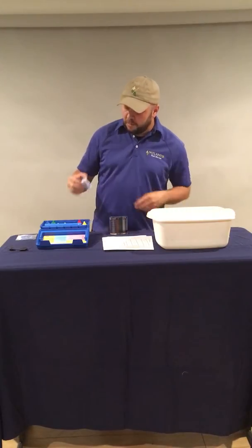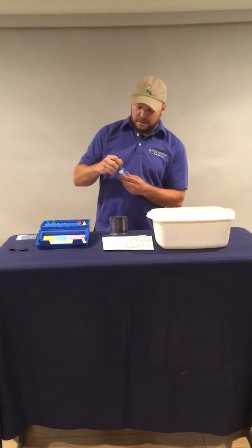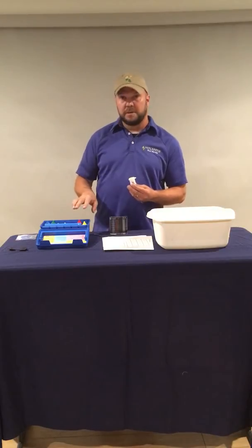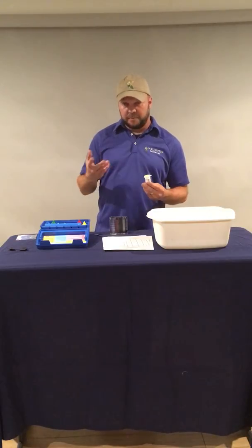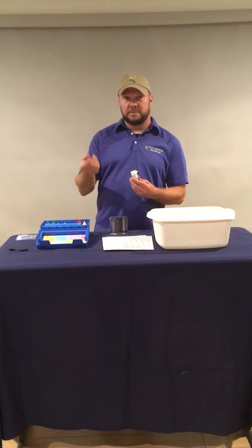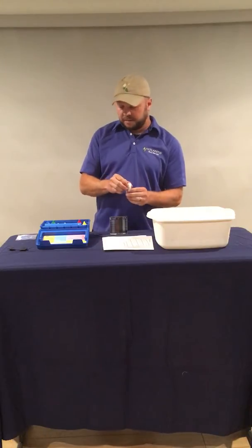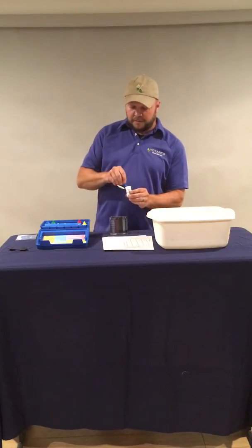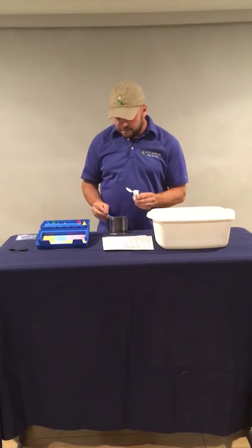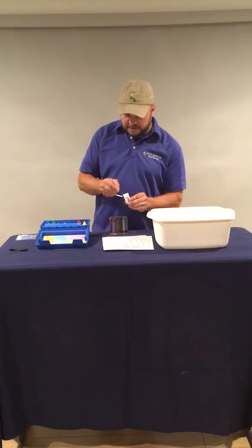So now with this kit, what we're going to do is take this powder, which is R870. And you never want to be dealing with the reagents when your hands are wet. So if you've taken the sample and your hands are wet, you want to make sure you dry them. If you touch the reagents with wet hands, that's going to potentially clog it up. So we're going to take the lid off. Now this is going to call for 2 level scoops of this powder, the R870.